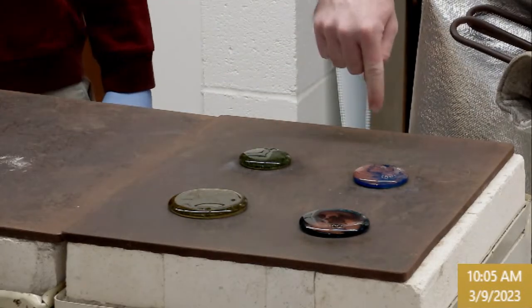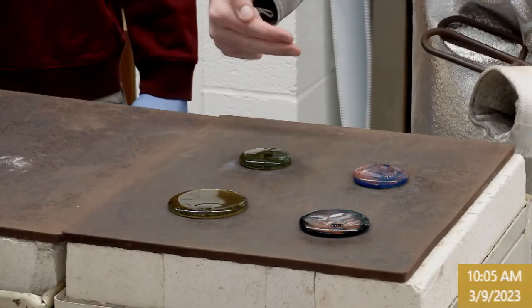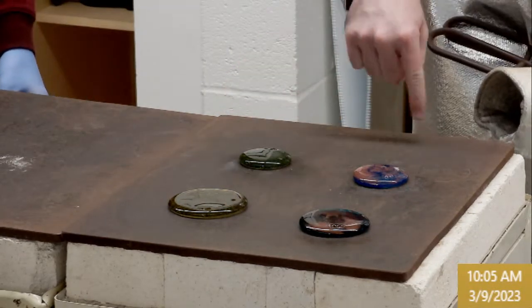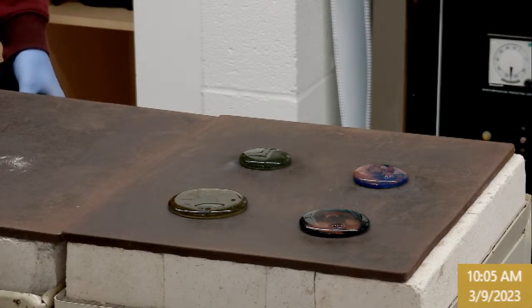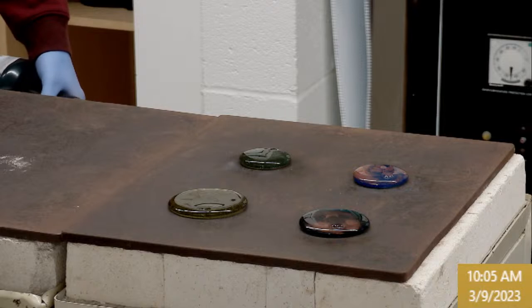So for the last one, put it right here and try to angle the torch pretty aggressively in this direction. Yeah, and just watch out for the heat from that one. But we'll pour that one here. All right, the last one is O. And so that's granusil. That's a high purity sand. Sodium carbonate, calcium carbonate, copper oxide. This is a simple composition with 0.3 grams of copper oxide.